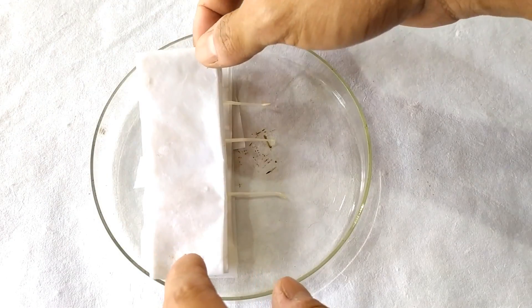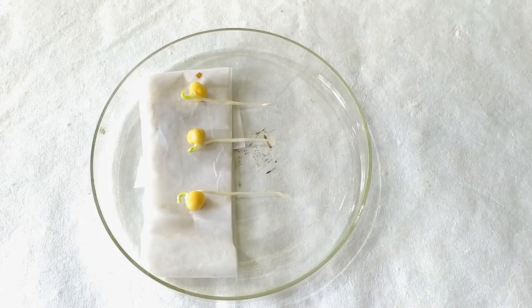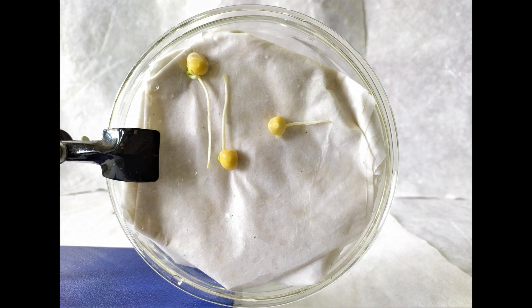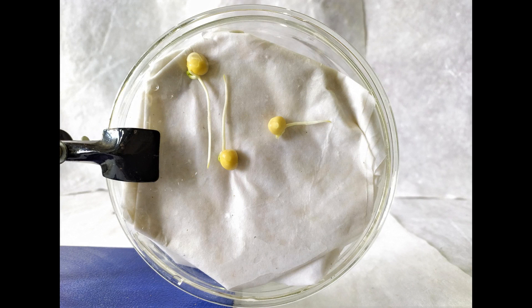Alternatively, you may arrange the seeds in the petri dish in this manner. Either way, once the setup is complete, position the petri plate vertically.